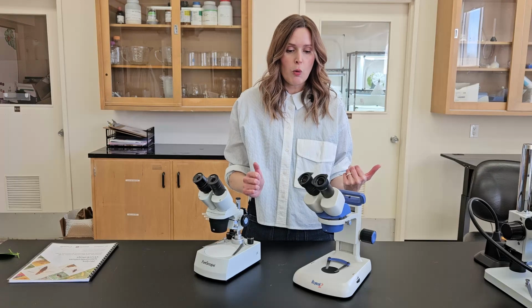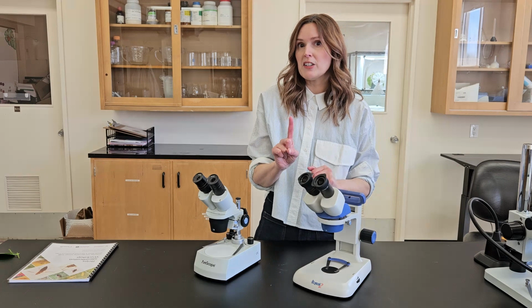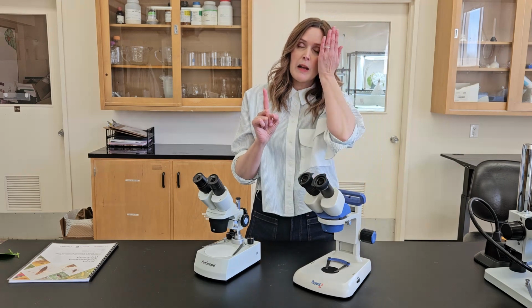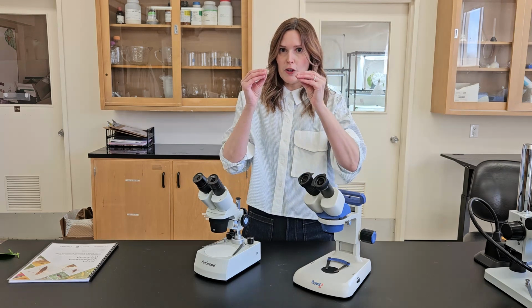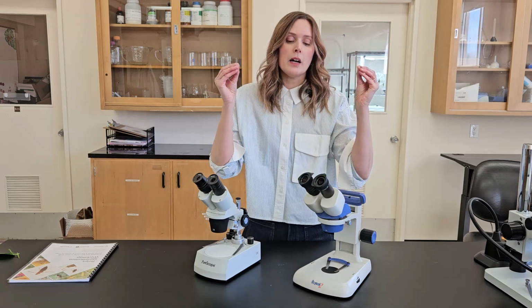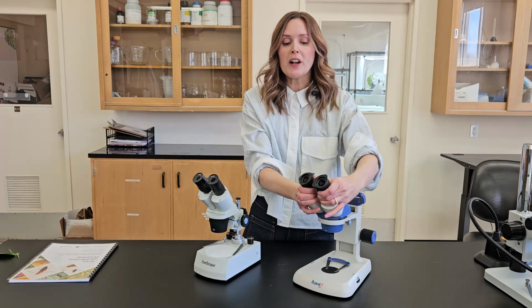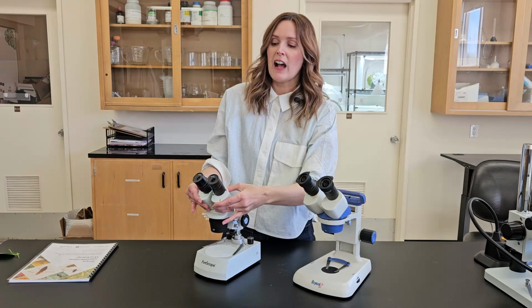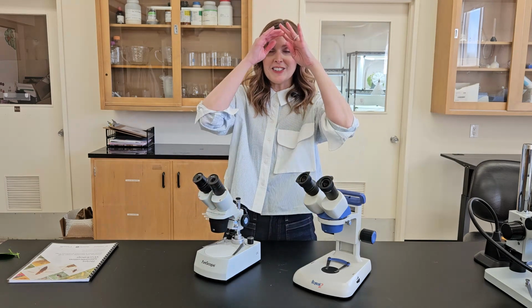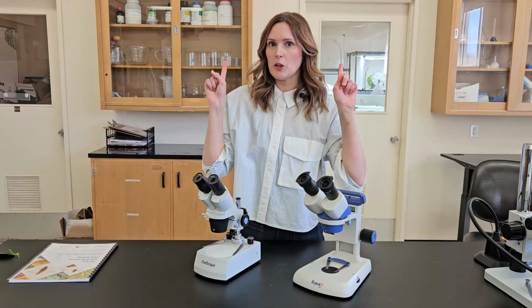The other thing you want to look for, and I think this is pretty standard, is two eyepieces. I don't recommend the ones that just come as one eyepiece, because that means you have to keep an eye closed all the time, and that can just give you a headache over time. Also, images are sharper when you're using both of your eyes and they're both in focus. But when you are looking at a binocular microscope, you want to make sure that the eyepieces can change in terms of how close they are. And the reason that matters is for people like me, where my eyes are pretty close together, versus some people who have eyes that are wider set.